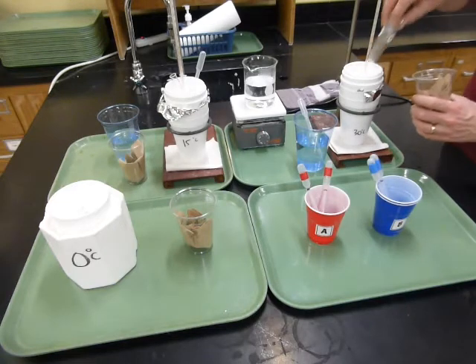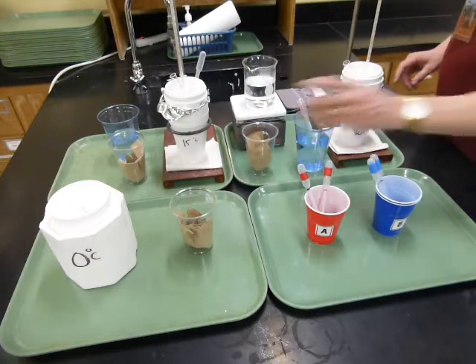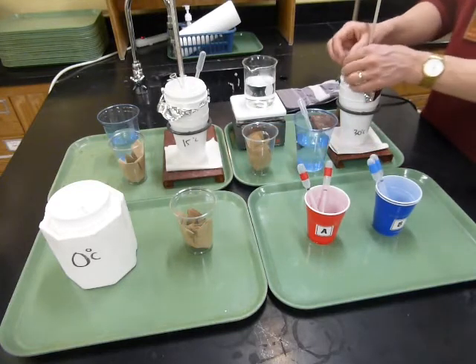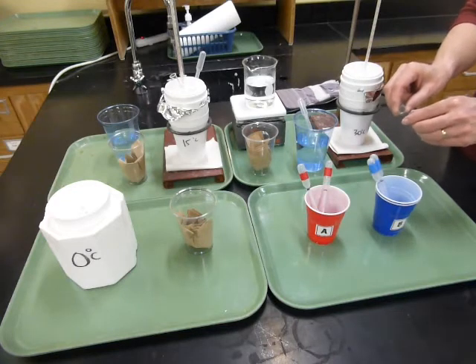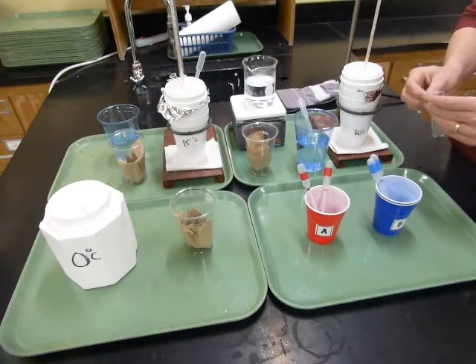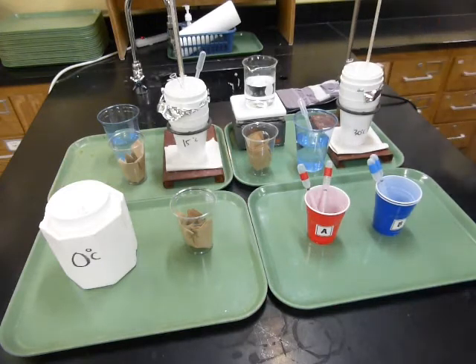Now, after these have been sitting in the temperature bath for about 3 to 5 minutes, then we'll take out a tube of A and a tube of B, and we'll pour them together into a little white cup and start the timer. When it turns blue, stop the timer and record the time, like we did before. And then when you're done, you can clean out those test tubes.